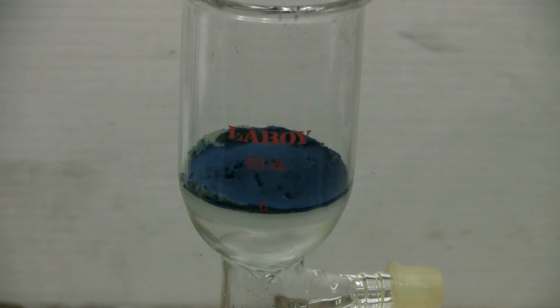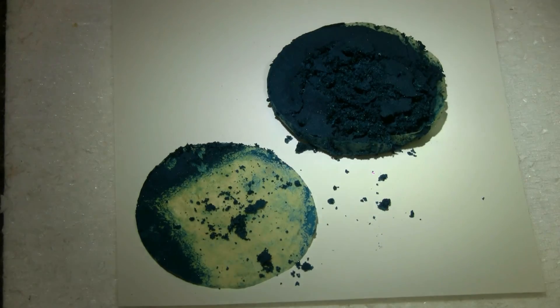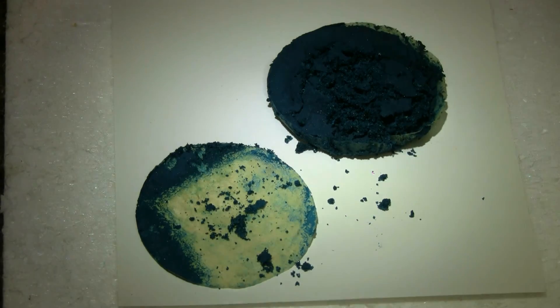The volume is greatly reduced in the Buchner filter cup. We now have fairly clean copper aspirinate that I'll get out and we'll get a better look at it when I have it drying on a piece of paper. Here's a look at our copper aspirinate, a dark blue precipitate. This evidently has some use in the treatment of rheumatoid arthritis.